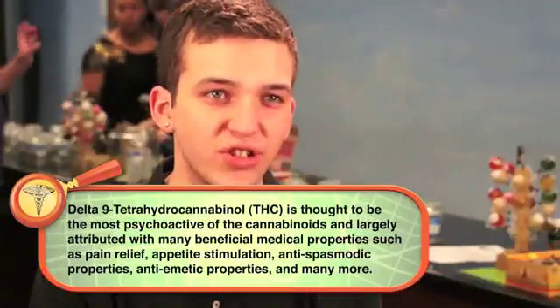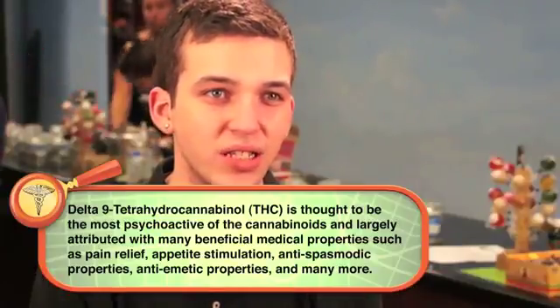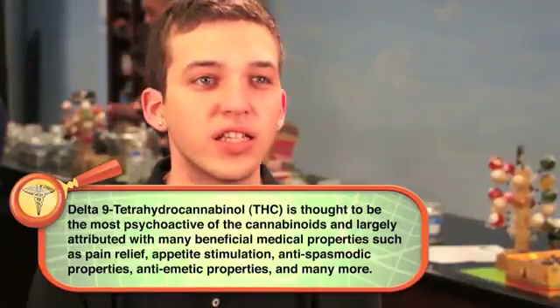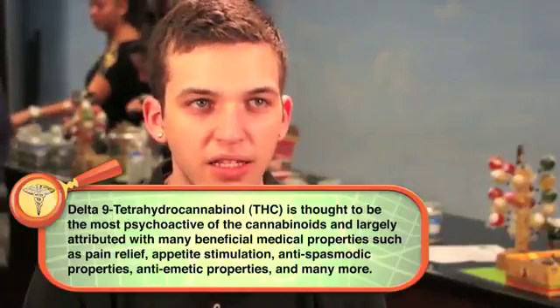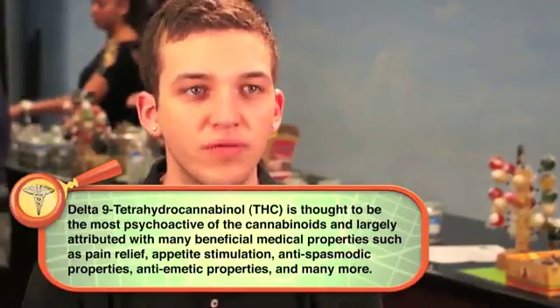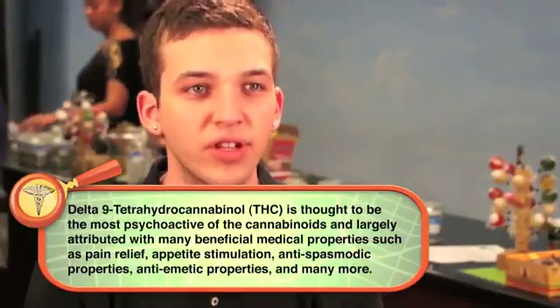Even though we just showed THC, CBD, CBN, we're still testing for molds, pesticides, all of those. So everything that comes in is definitely clean.